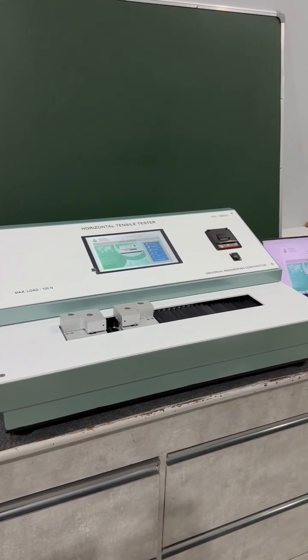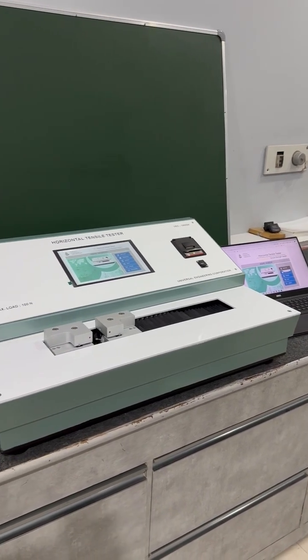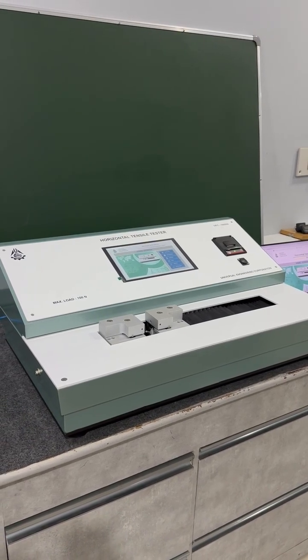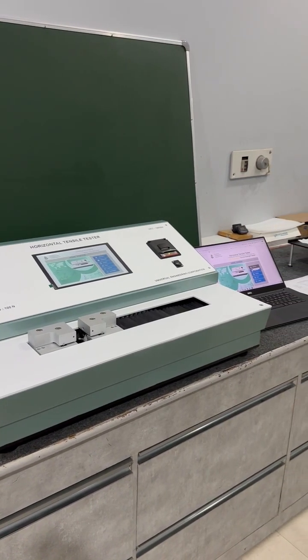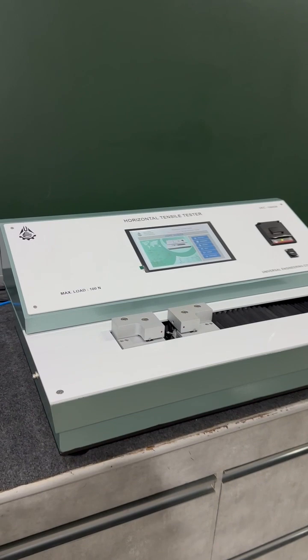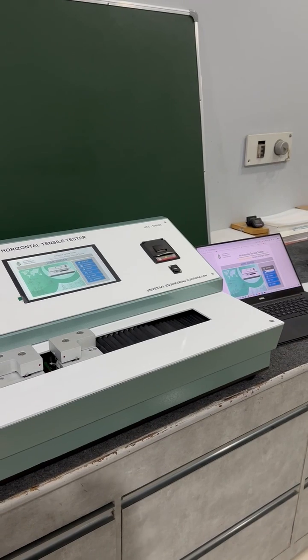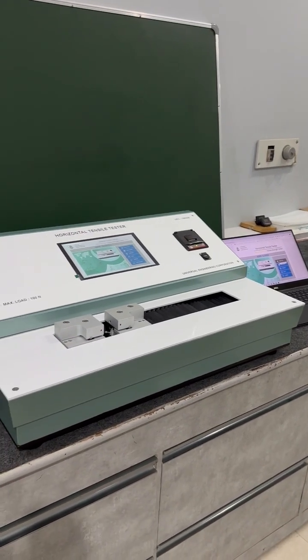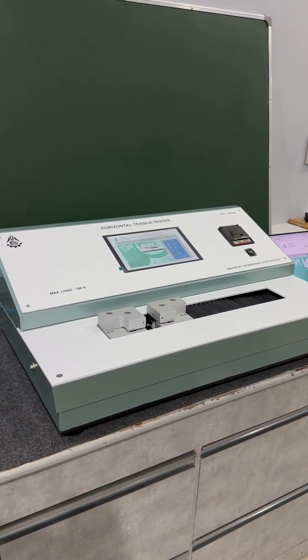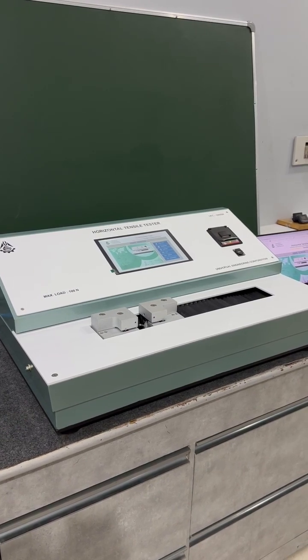One such improvement is the new software that serves as a control center for the machine, facilitating the execution of tests, monitoring of data, and analysis of the results. The primary purpose of the newly launched software is to provide users with a centralized platform to manage and conduct tests on the machine. It offers a user-friendly interface for configuring test parameters, initiating test procedures, and analyzing the resultant data. By using this software, users can streamline the testing process, ensure accuracy and consistency in measurements, and derive valuable insights from the test results.